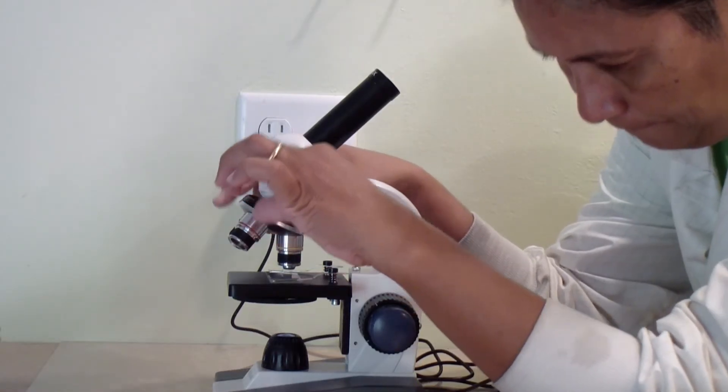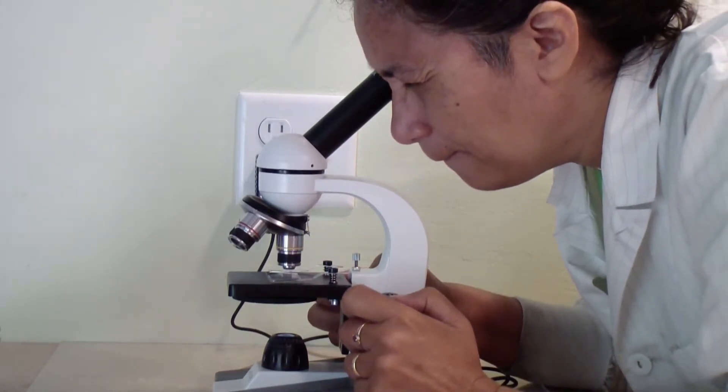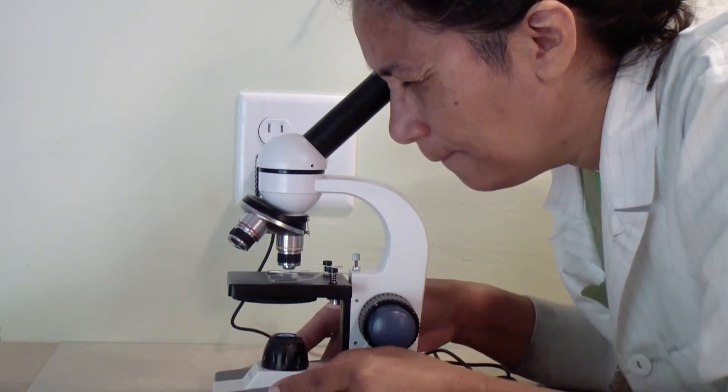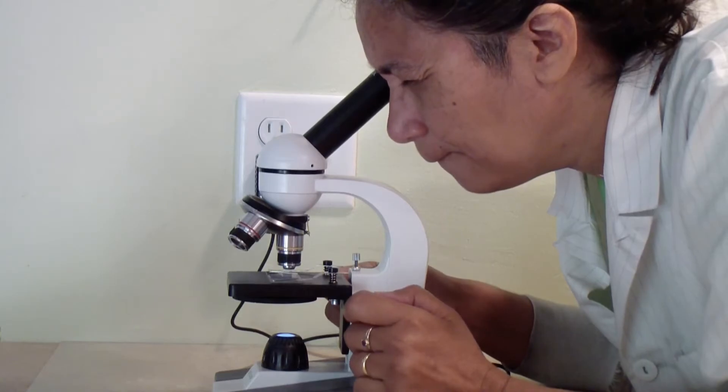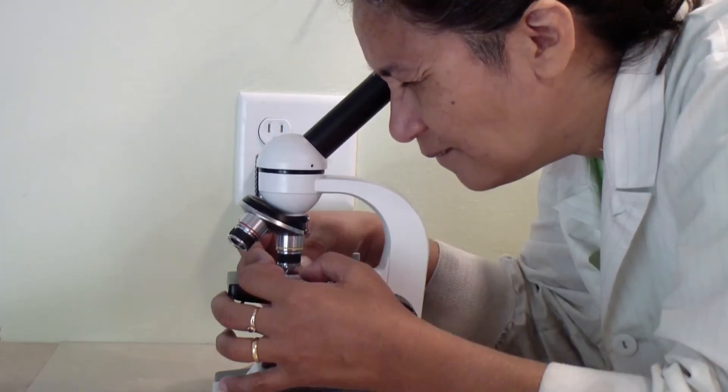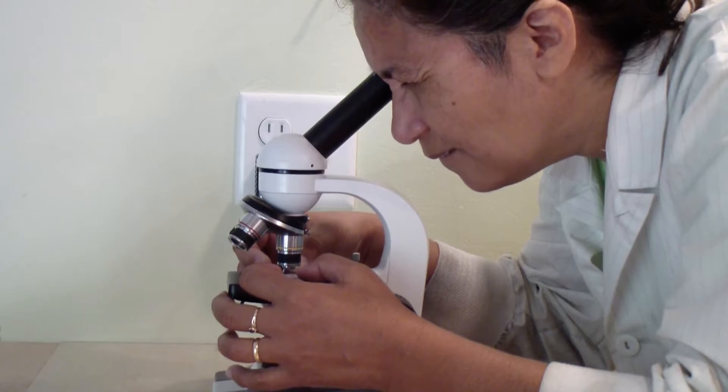Look for moving things on the slide. If you see something interesting, you can increase the magnification. Turn to the next objective lens and use only the fine focus to bring the view into focus again.